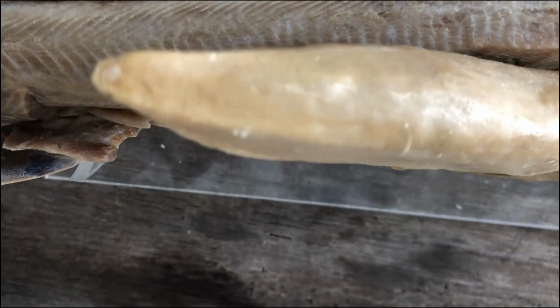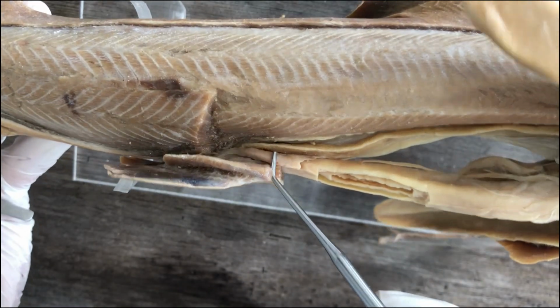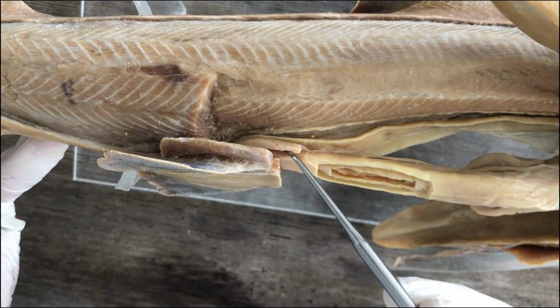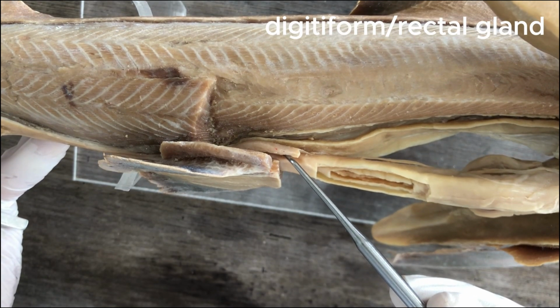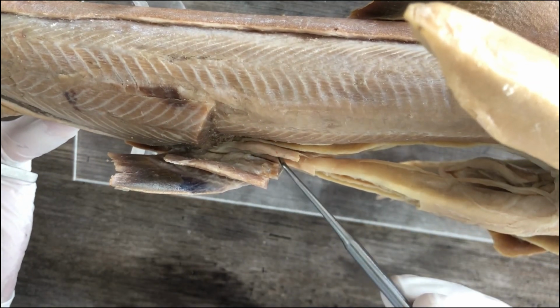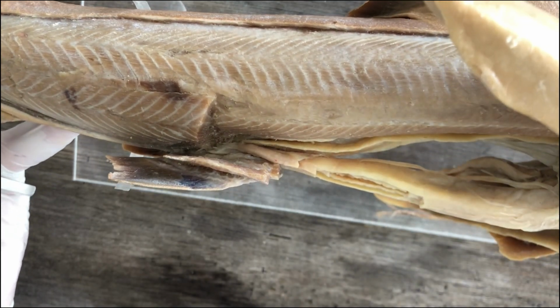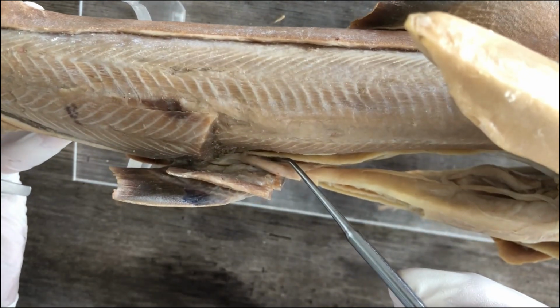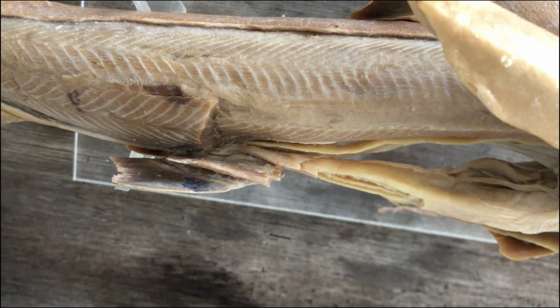And that would be this structure here, this sausage-like structure. This is the digitiform gland or the rectal gland. And it basically acts as a salt secreting organ. So it secretes excess salt into the colon so that the shark's body fluids will not be too salty.